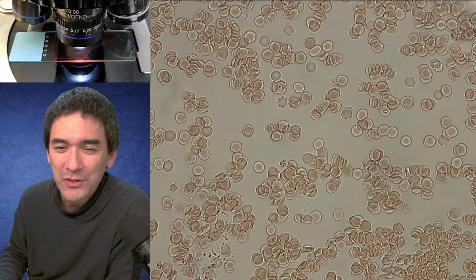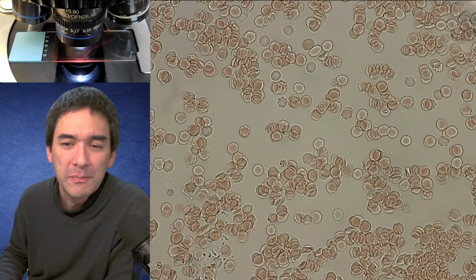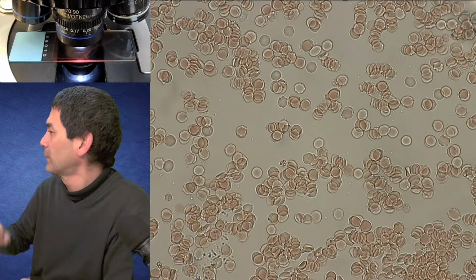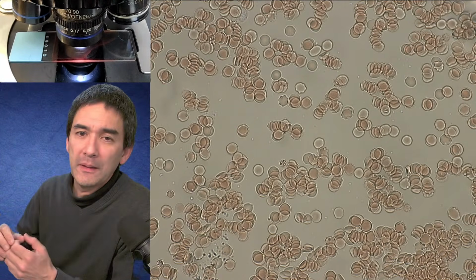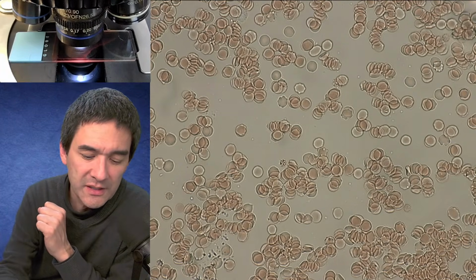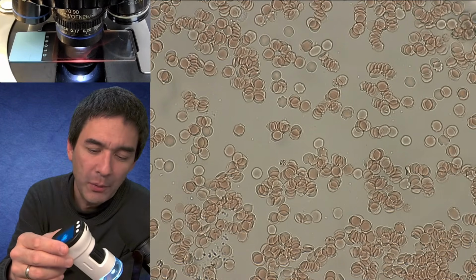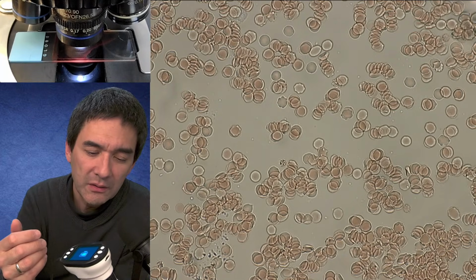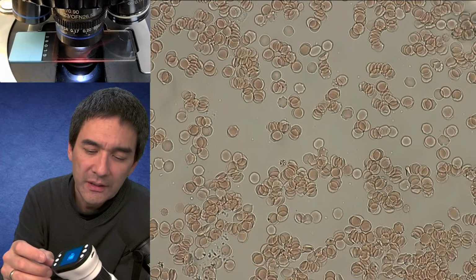I'm going to jump downwards. How do you compare it with your second USB cheap microscope? The second one that I have is, I don't know, I put it somewhere over there. I would say the image quality is similar. The reason I bought this one is convenience, really, so you can walk around.